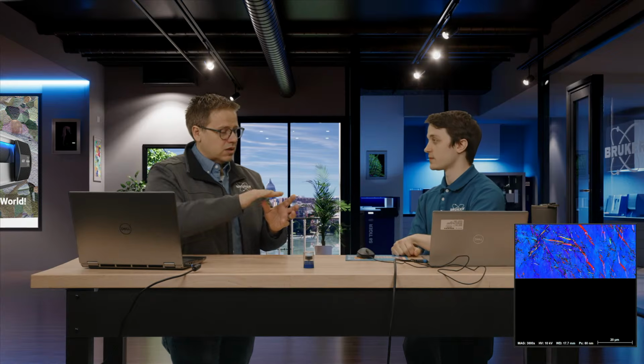Neat. So the Kikuchi lines are those diffraction lines, and like you said, we index, bam, we get orientation. Yep. And that information we're getting is structural information, so it's very complementary to what you might get from the EDS. Indeed, which is elemental information. Cool. And you could do the mapping on the same area if you wanted, so you could even get multiple pictures and things like that.